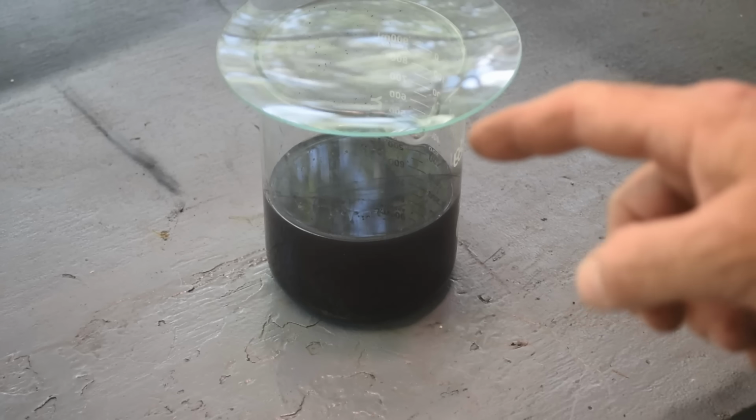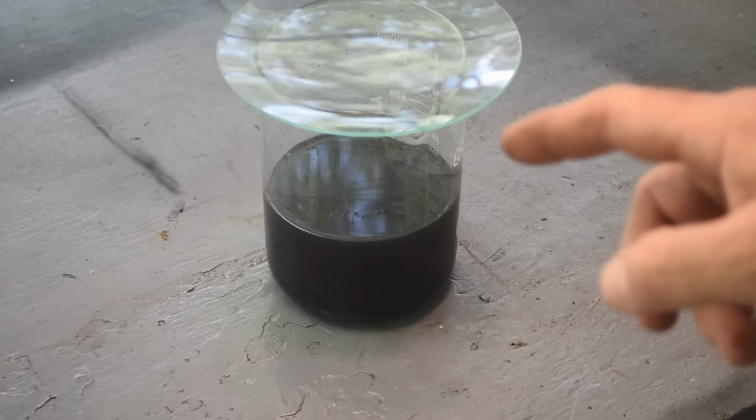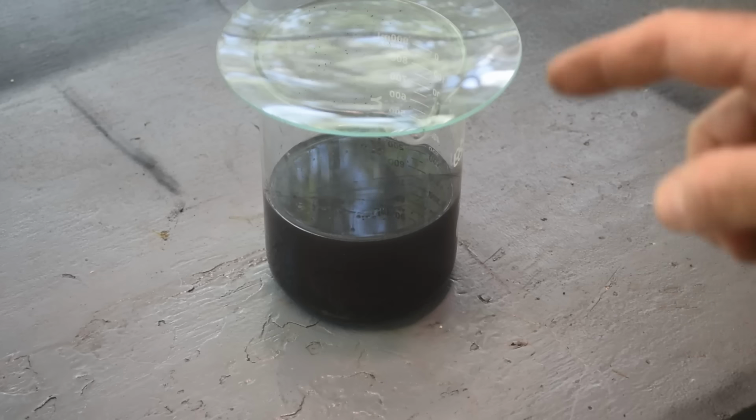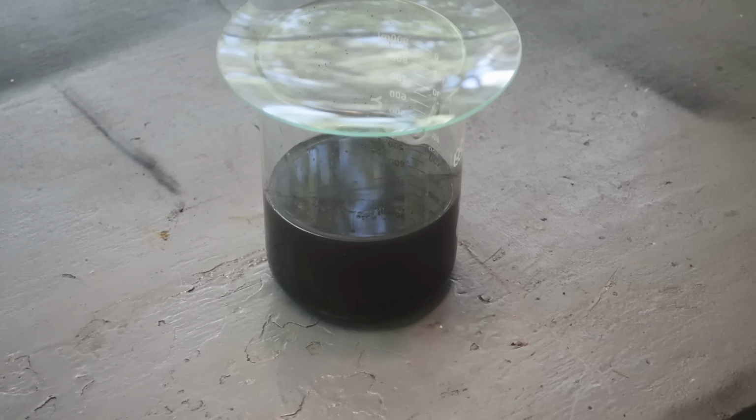So plan A for dealing with this stuff is out the window. I'm going to have to come up with a plan B. So let me think about that for a minute and see if I can salvage this project and get it finally done. You know, today would be nice. Today would be a great day to finish this project. So let me put on my thinking cap and figure out what we can do here.